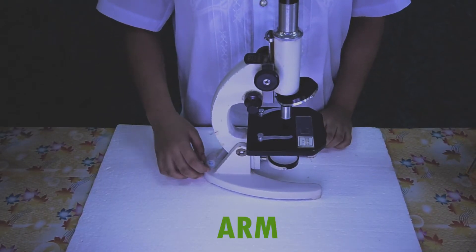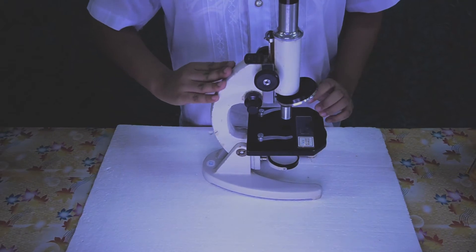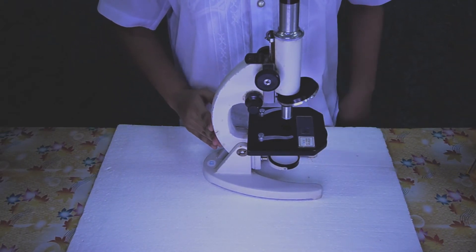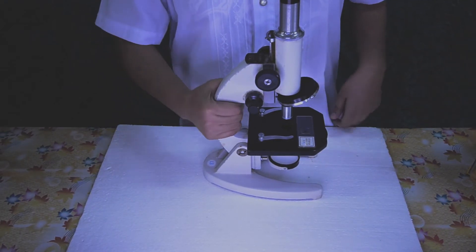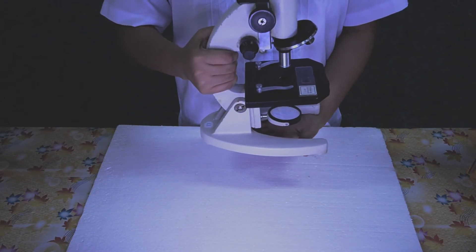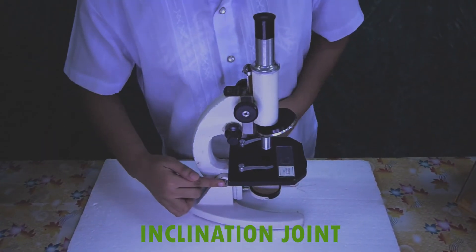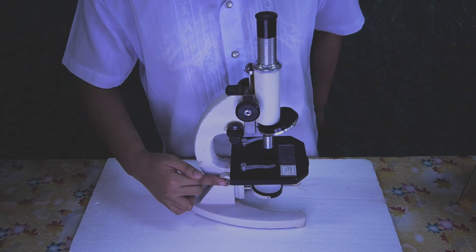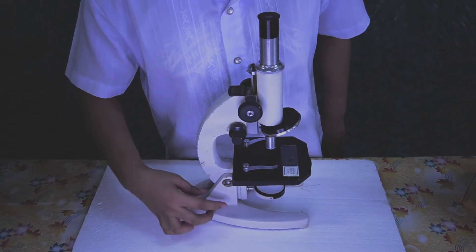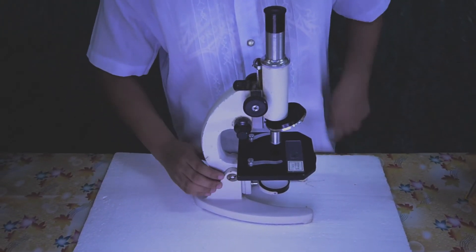Arm. It is a curved and strong structure used for handling the entire instrument. Inclination joint. A joint at which the arm is attached to the pillar of the microscope.